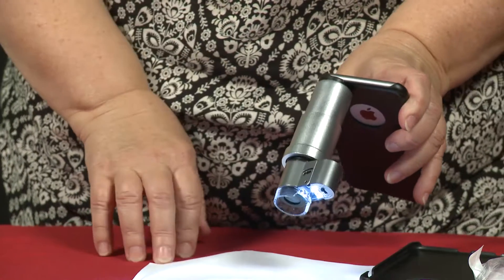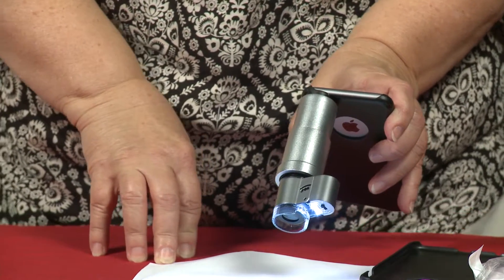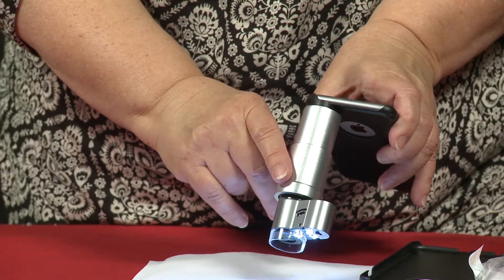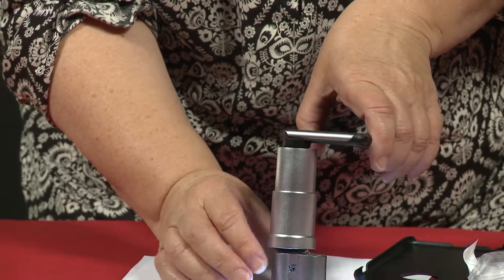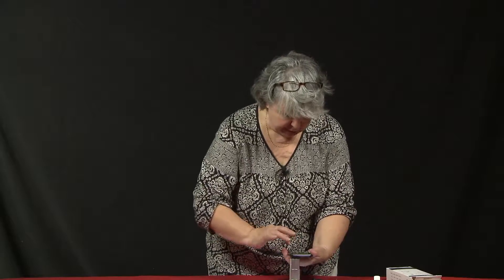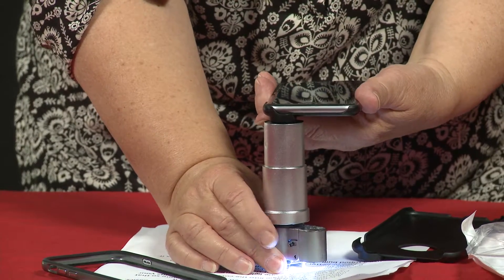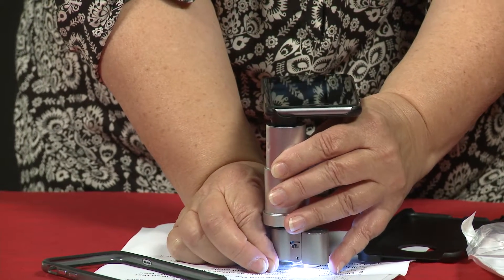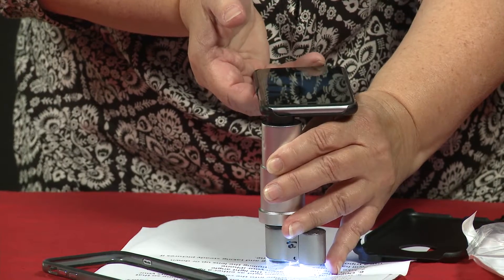To actually focus this, if you have a tripod that works for an iPhone, that would be a really good idea to use, because you might find that you have some trouble focusing this if you don't have a tripod. I'm going to put it down on some letters on my piece of paper and turn my iPhone so that I've got my camera on. I'm going to focus it on the page, and by moving this up and down, I can focus it. Once it's focused, I can then take my picture.